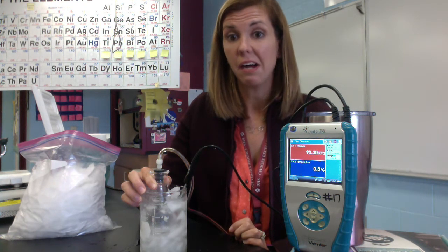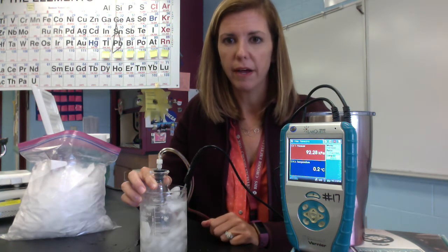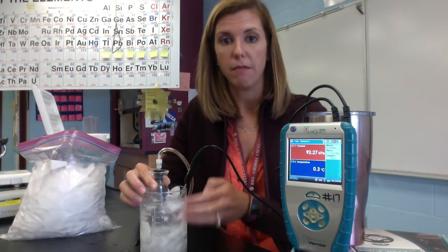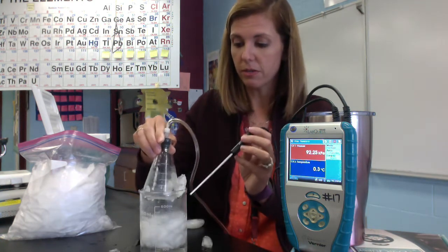So it seems to be wanting to stay right at that 0.2, 0.3 mark. Remember the significance of that when it jumps in between is some estimation between those values. And so we're going to say that that's our consistent temperature and pressure of our ice bath. We are now going to depress the temperature of that ice bath.